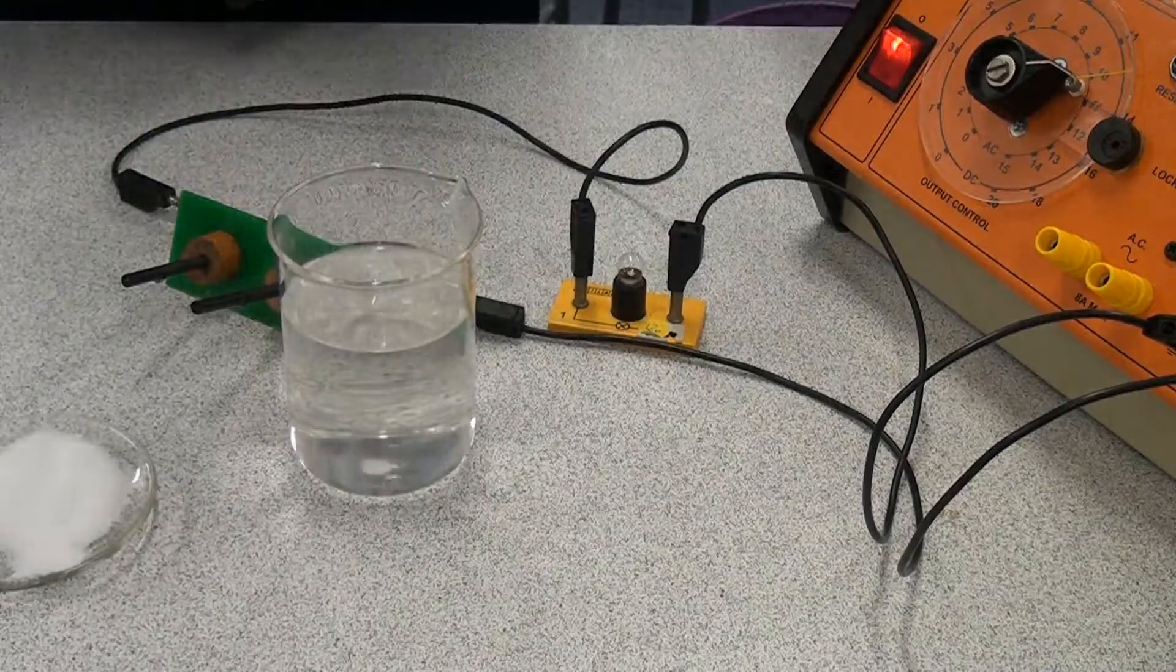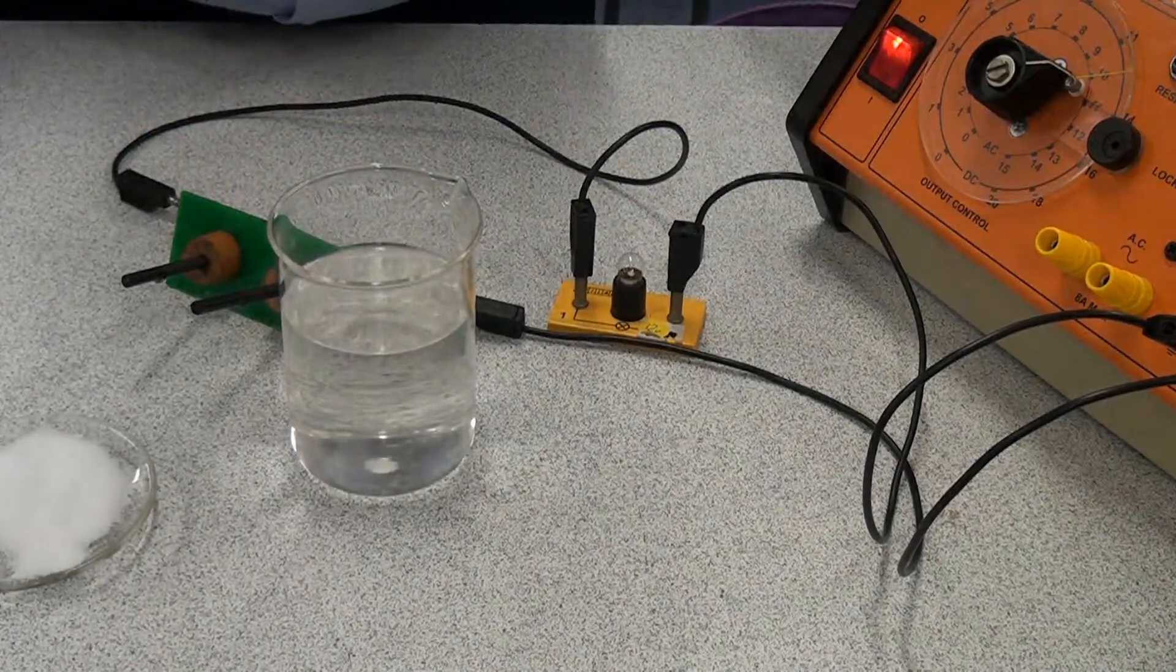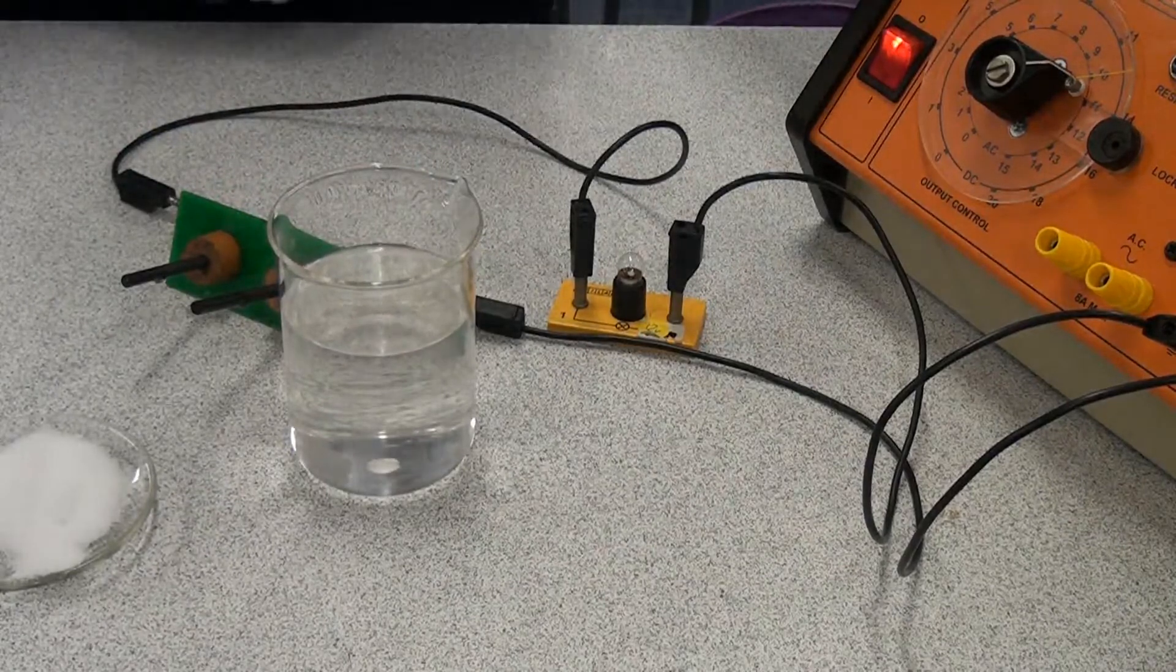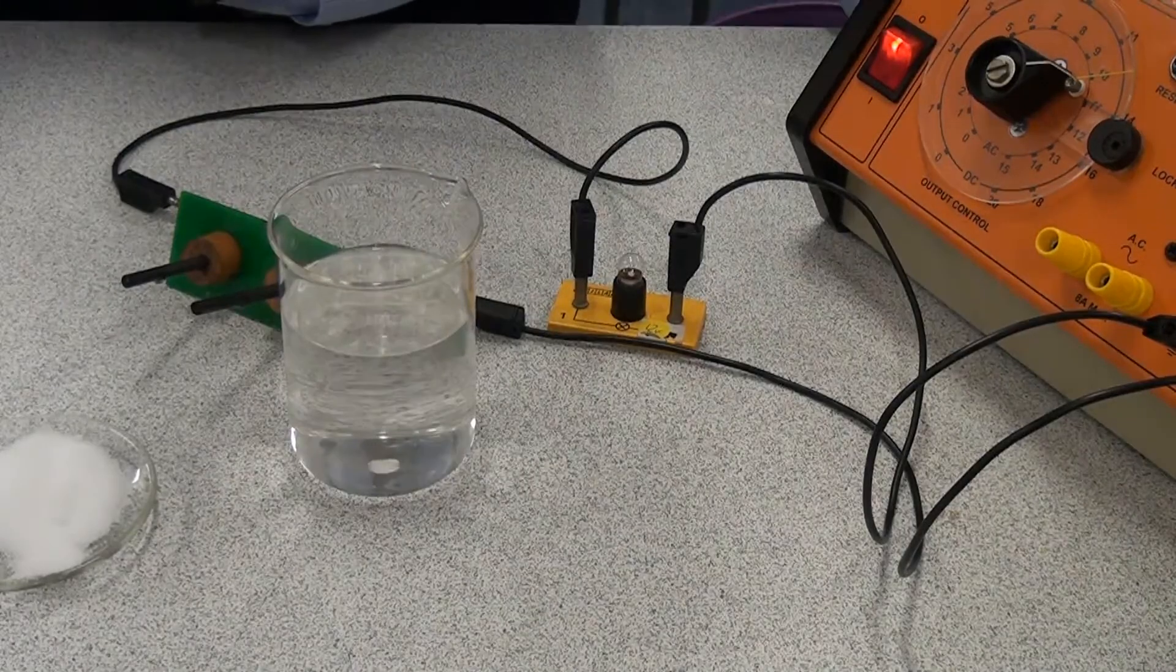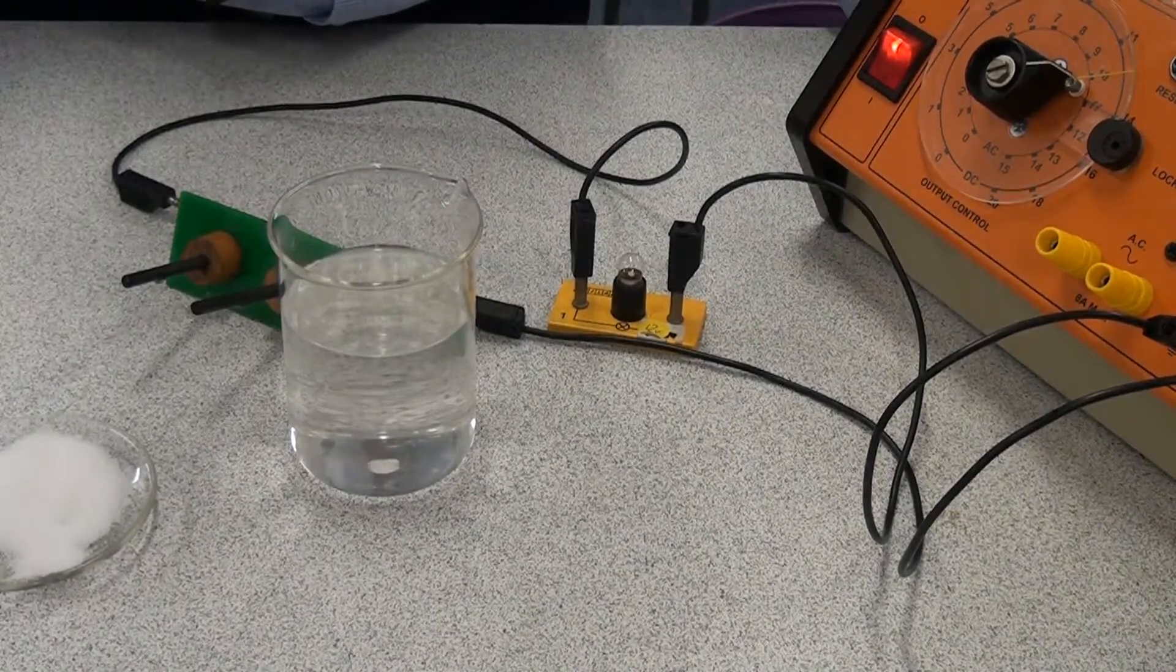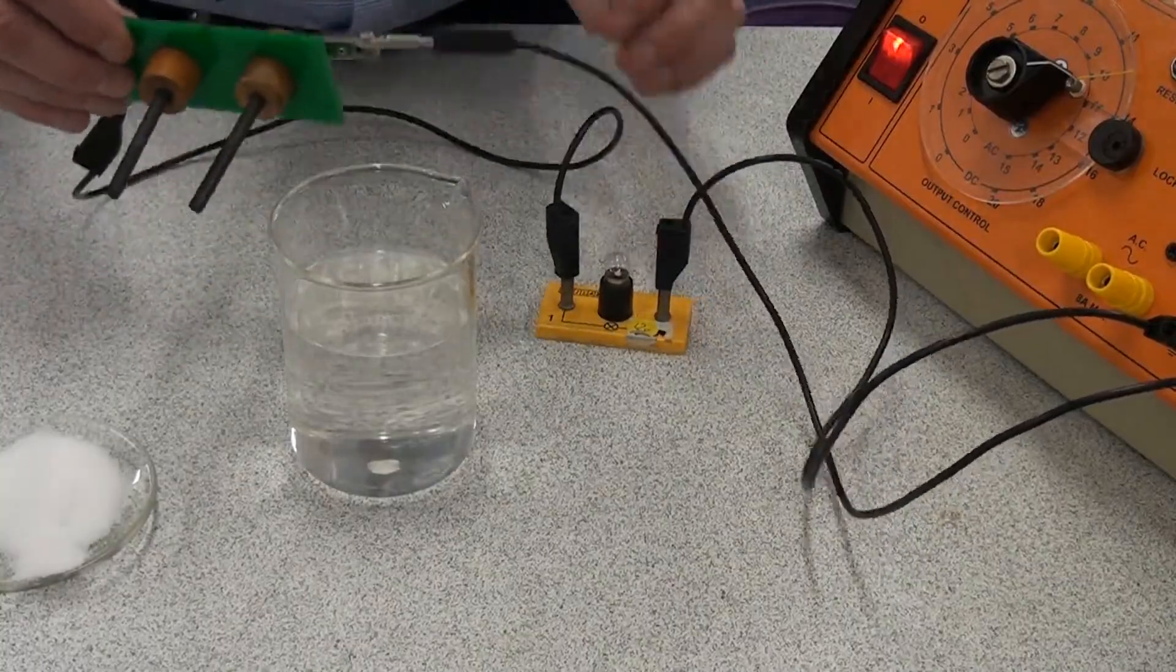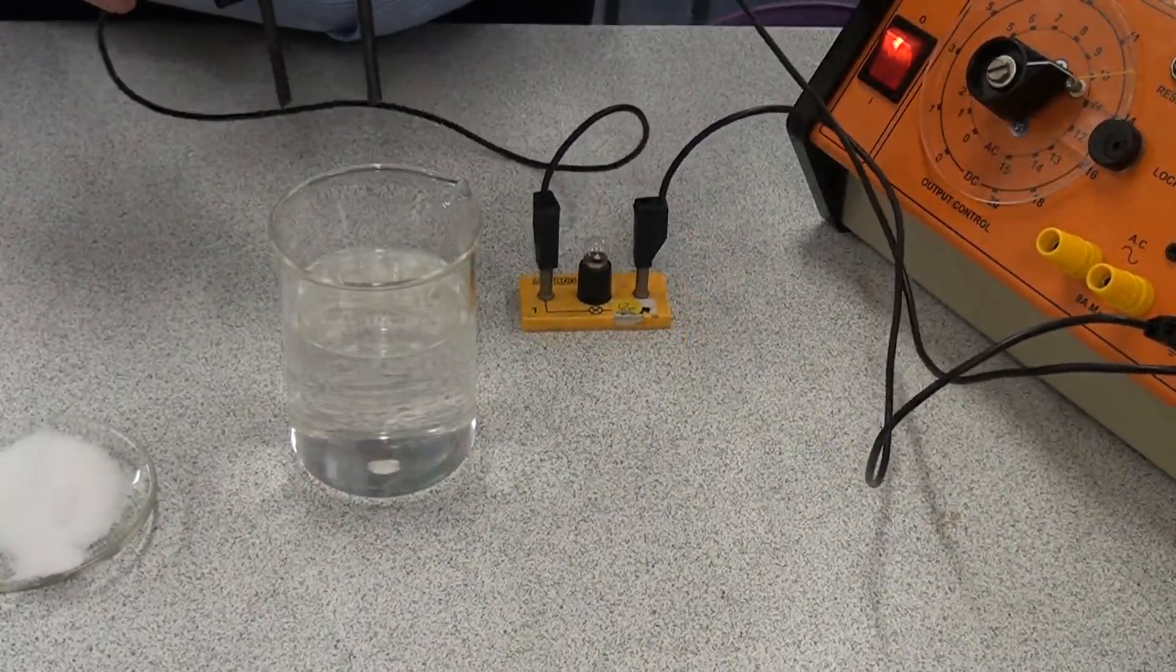And then we're going to try and put electricity through this solution. Now I'm keeping the voltage very low by using this power pack. That's what makes it safe. Please don't ever try putting electricity through water at home because it could be fatal. So let's see this time what happens. Can it conduct electricity?